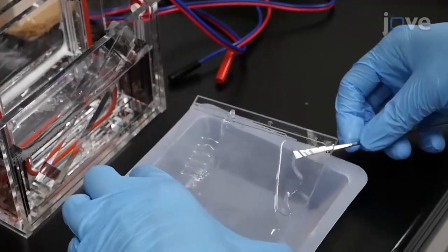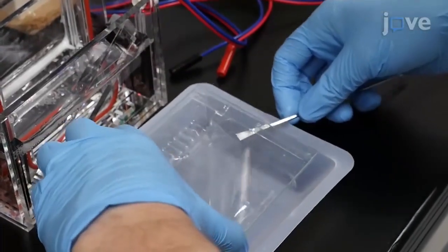Our method can be extended towards ultrasensitive and advanced molecular concentration assays, which will lead to future diagnostic methods, allowing efficient findings of pathogenic molecules in specimens. Our method can be applied to single protein species analysis using fluorescent antibodies, as well as multiple species analysis using non-specific labels for all the proteins separated by electrophoresis or chromatography.